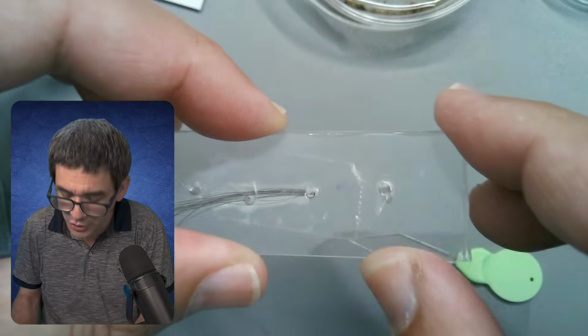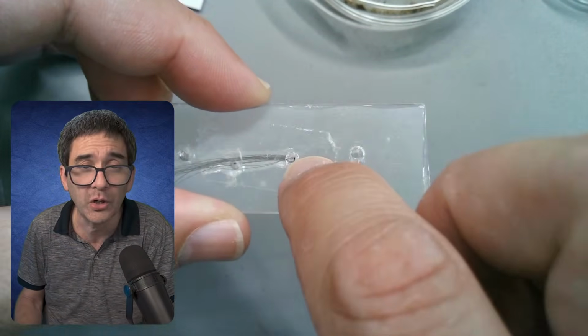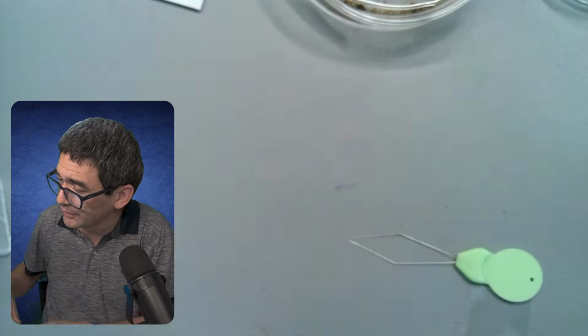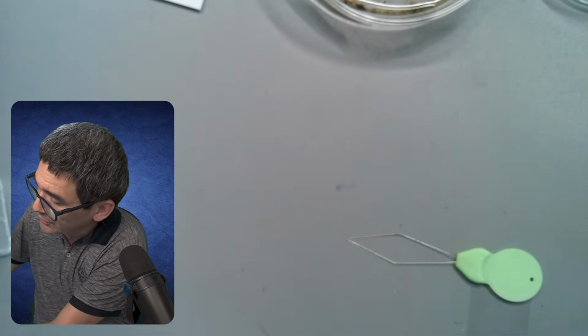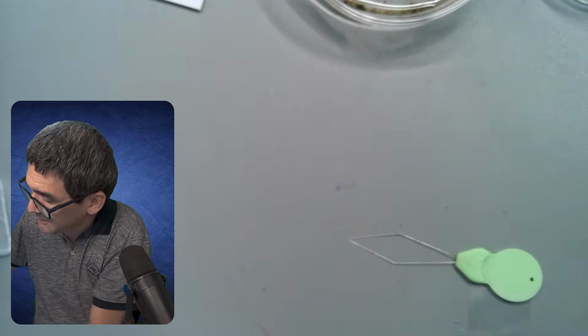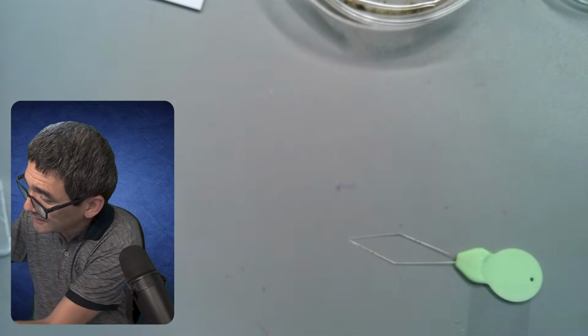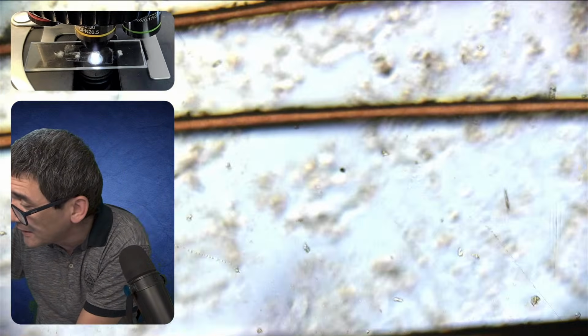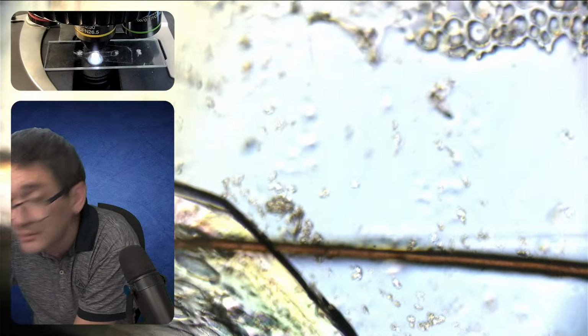So I'm just going to quickly show this to you. It's a little bit too dark, but I wanted to have a look at those hairs right from the edge on, and that's the last thing I want to show you. The live stream today has been a little bit longer than I intended. But it's too dark, so unfortunately it didn't quite work out the way I wanted.